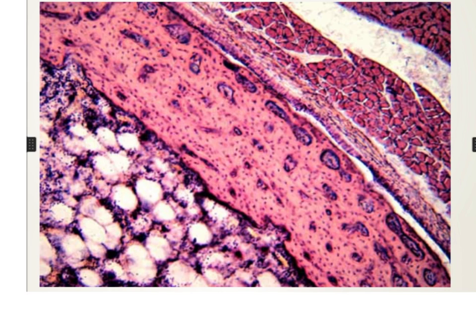In this photo you can diagnose the skeletal muscle, transversely cut skeletal muscle fibers attached to the surface of the bone, while this ribbon here is formed of the decalcified compact bone.